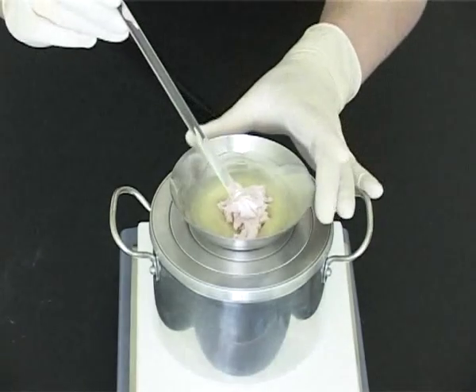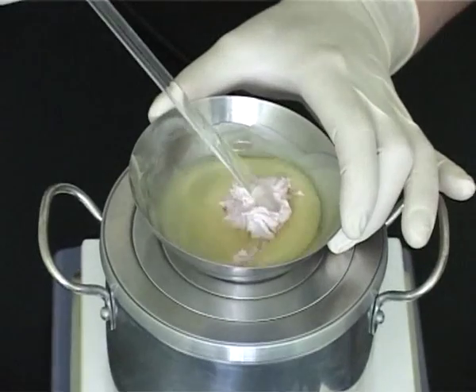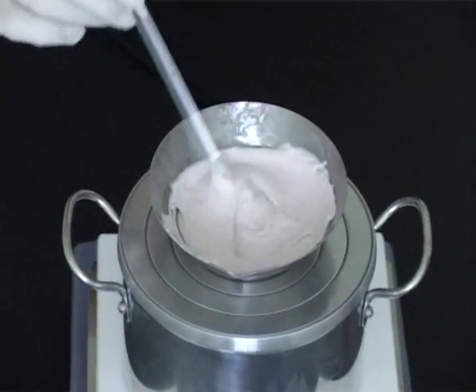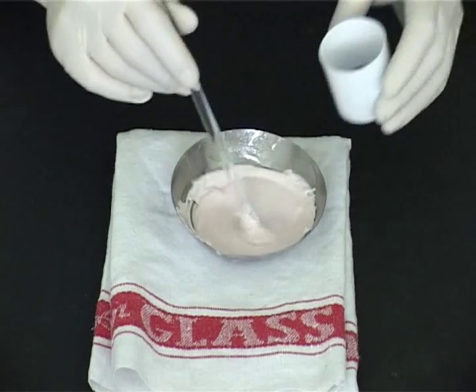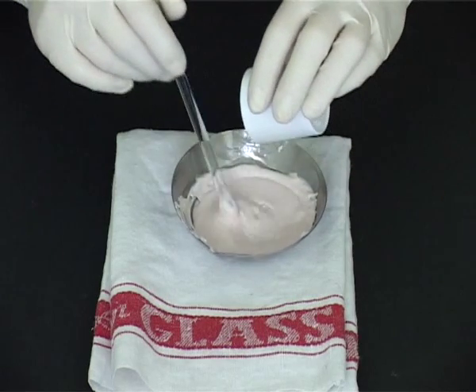Stir until homogeneous, reheating if necessary. Once homogeneous, the ointment may be removed from the heat source and stirred gently until cooled. Once the ointment has cooled sufficiently, any liquids may now be added by stirring until homogeneous.